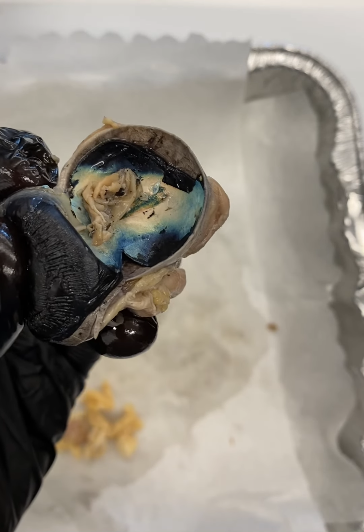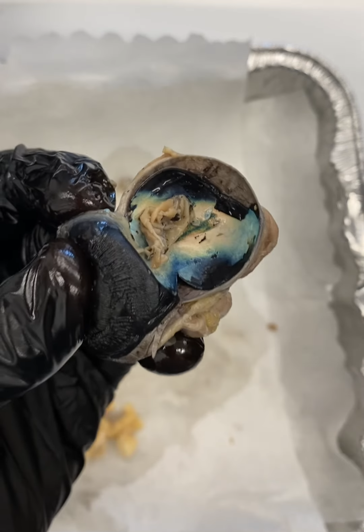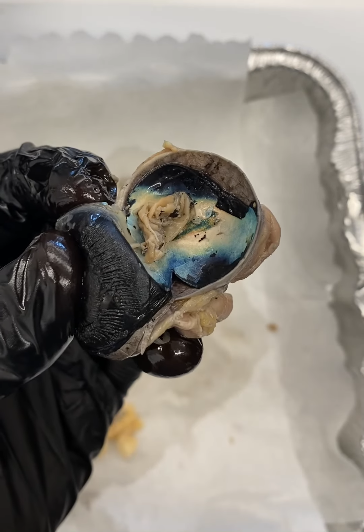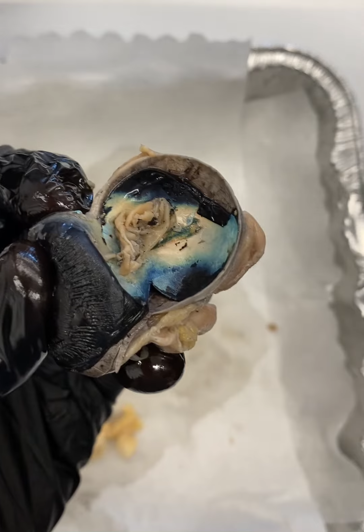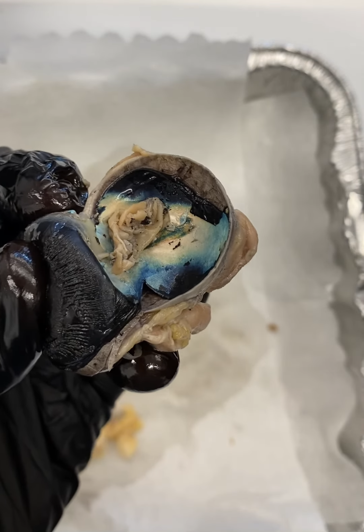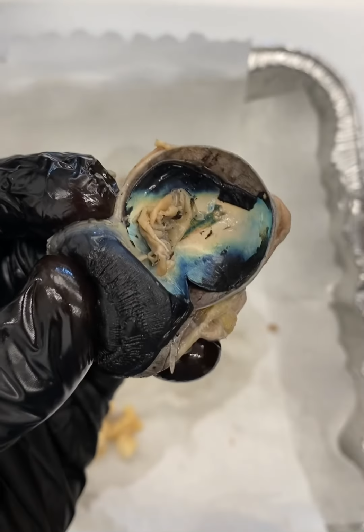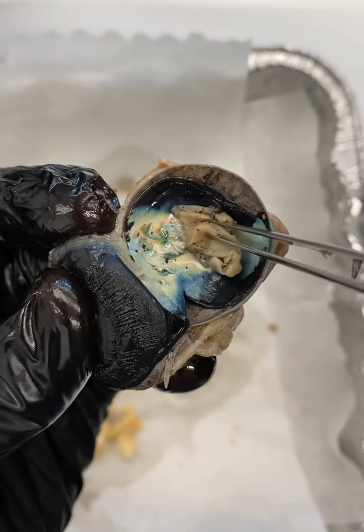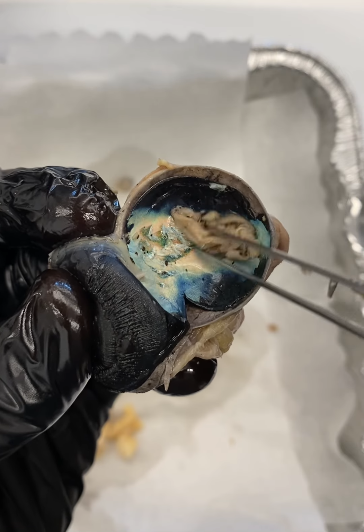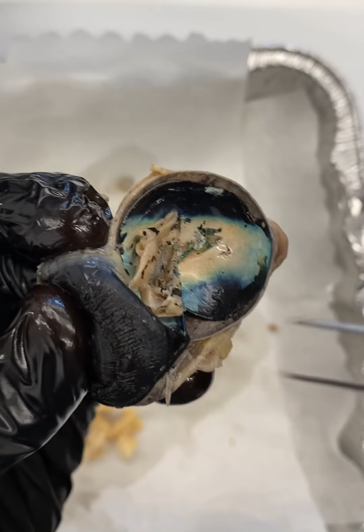When the light from that note card strikes the optic disc of the uncovered eye, you no longer see the object. This is easier done than described. I probably didn't do a very good job describing it, but this is a good illustration of the blind spot. So again, this is our optic nerve, our retina with the optic disc.